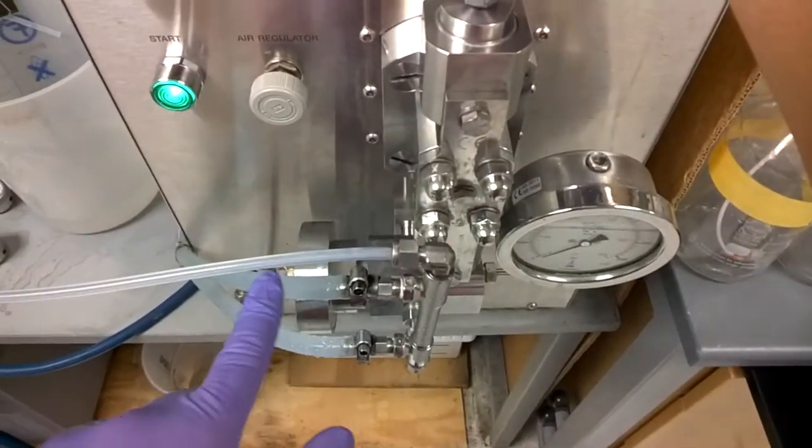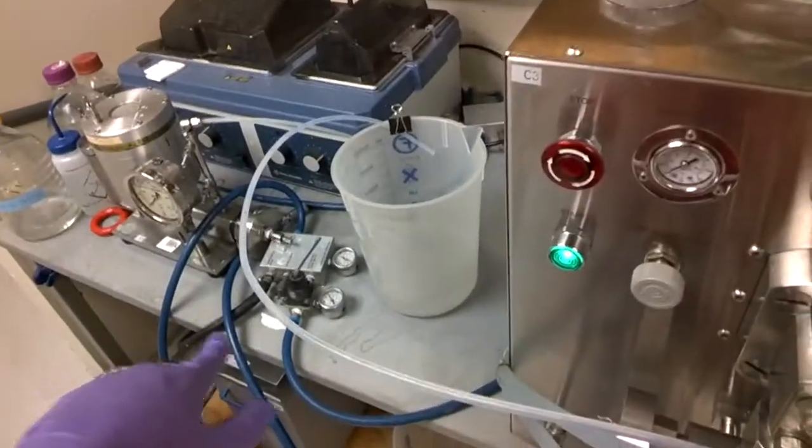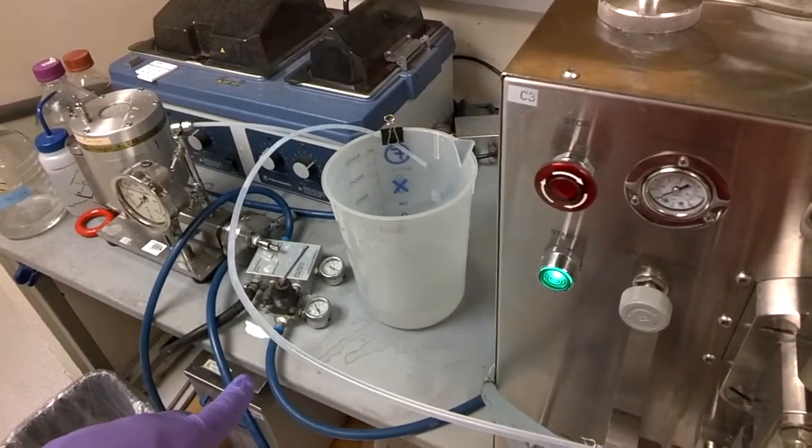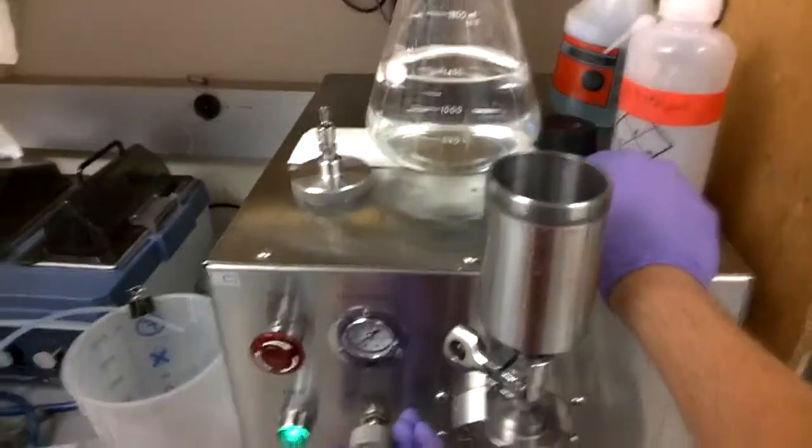And you can also, at some point, see over here, fluid start going up. I don't know if you'll be able to see it or not, but you can see it over there. And then it should start coming out of the actual hose. And now we can bring the pressure up.